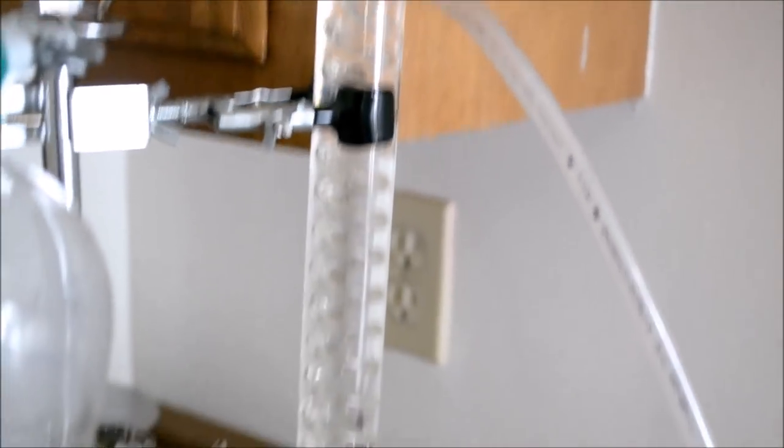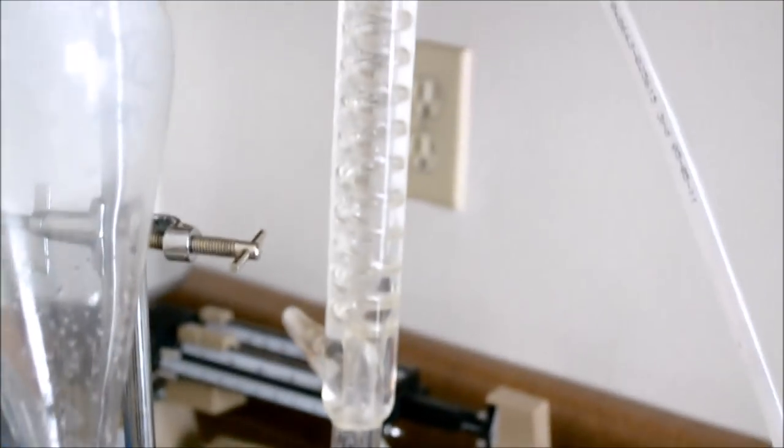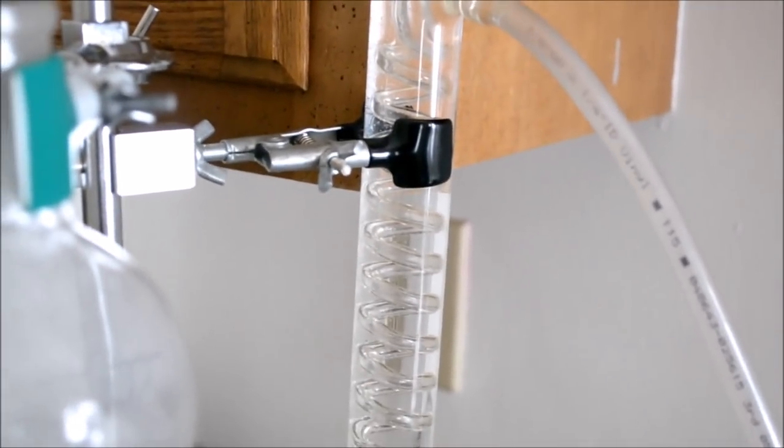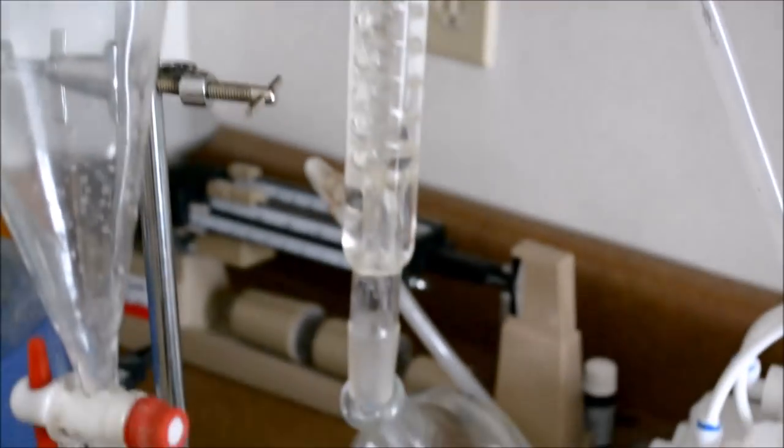As you can see, the water completely surrounds the coils. If it was dripping from the top, it would just run over the coil. I've tried it both ways. I've had decent results both ways, but from the reading I've done, this is the best method.